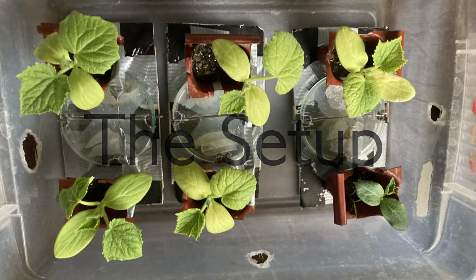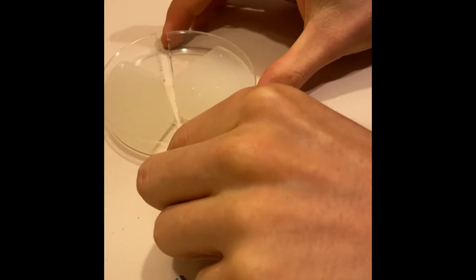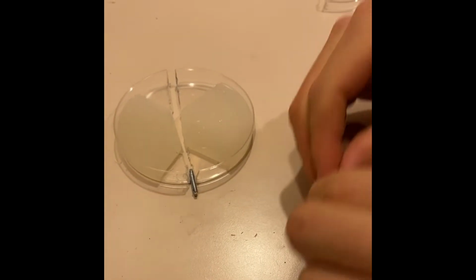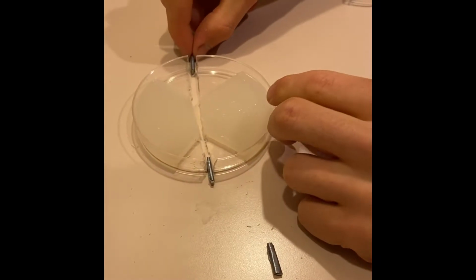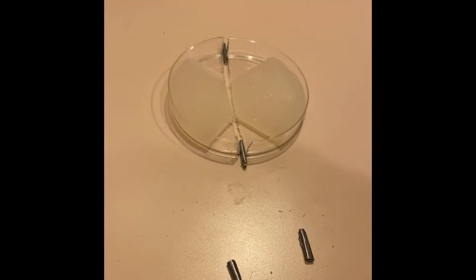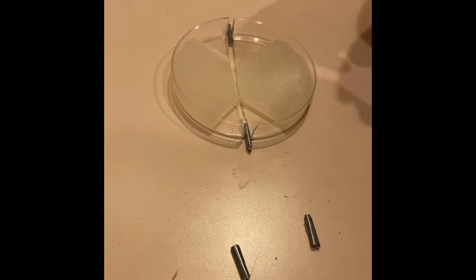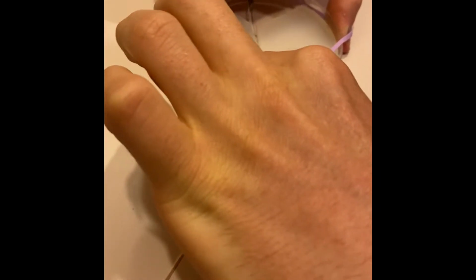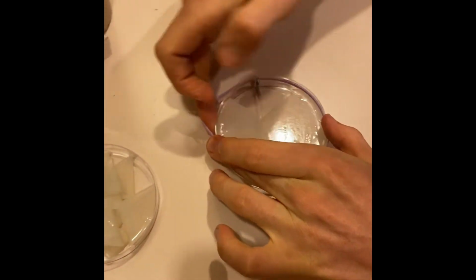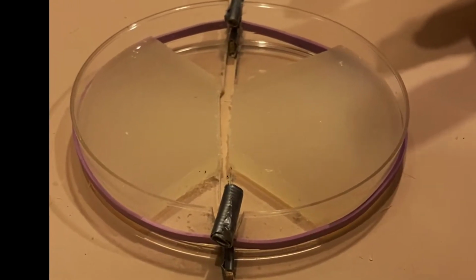The setup has been designed to isolate any conductive connection between the 2 islands of agar, and furthermore to support the mycelium growth and bridging near the center of the agar plate. The 2 halves of the plate are separated with small wooden shims placed on the edges. Then the whole plate is tensioned together with a rubber band stretched around the outside of the plate. This creates a gap between the 2 agar islands, and therefore a break in the electrical pathway.